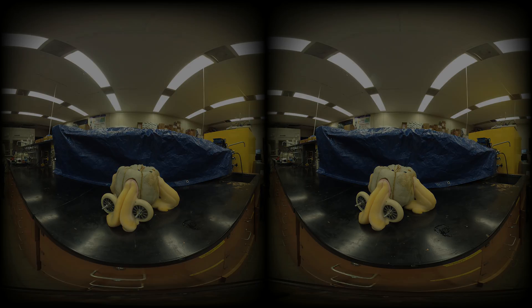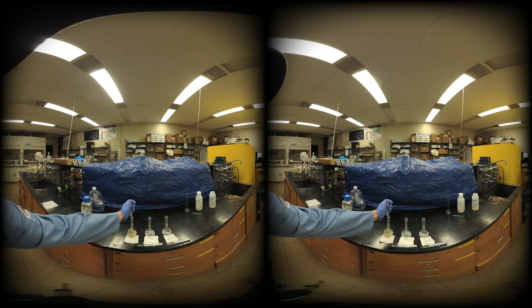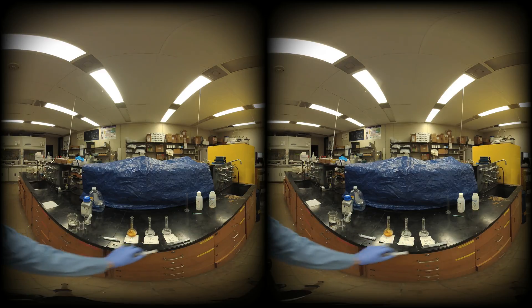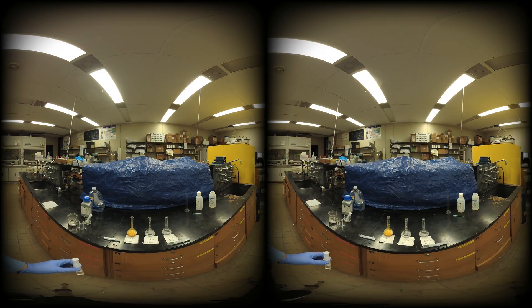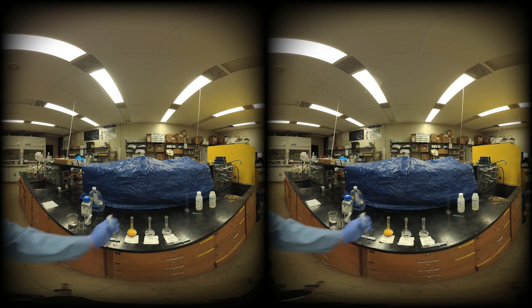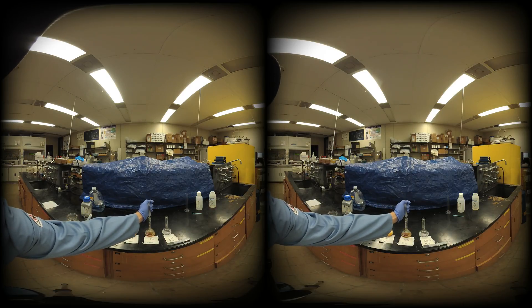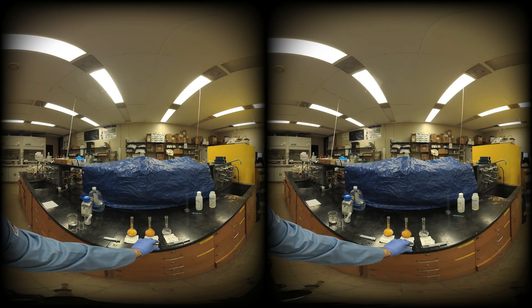The generated oxygen gas escapes from the solution via soap bubbles. The generated bubbles take up a lot of volume and can quickly fill the container. Should the container not be big enough for the large amount of bubbles, the foam can escape making a geyser.